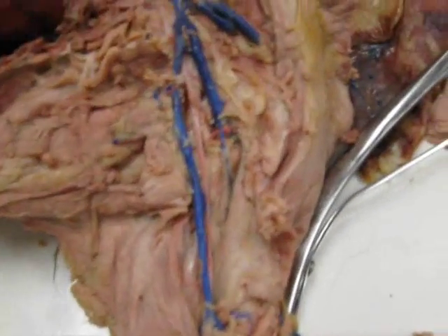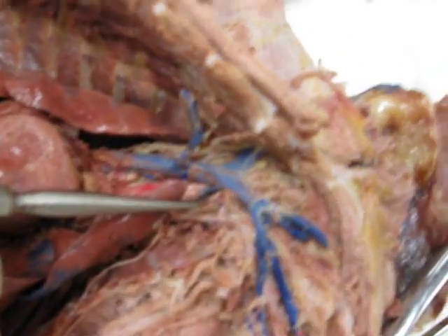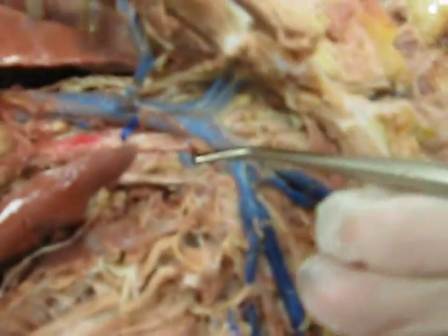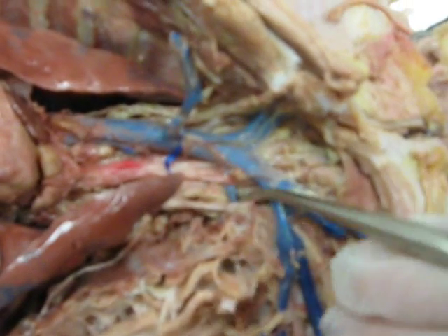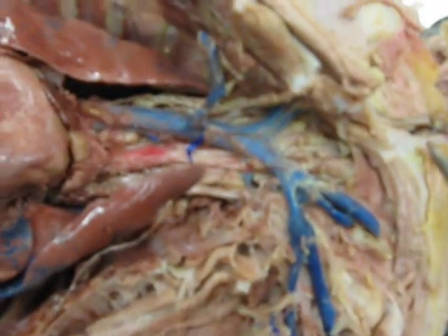Okay, you also have a vertebral vein. That vertebral vein is going to be coming from, okay, your vertebral is here, coming off of the brachiocephalic. That's going to go deep within the body and up the neck from the brain.